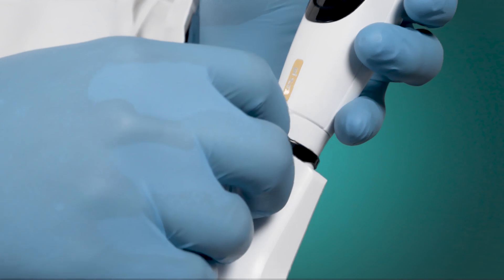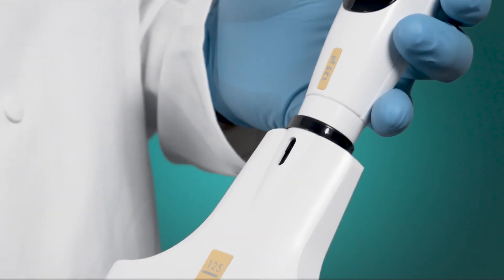Before installing a pipette in the Assist Plus, remove the small plastic cover from the pipette.